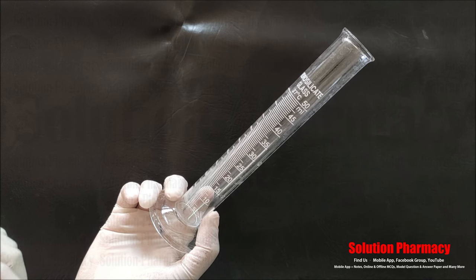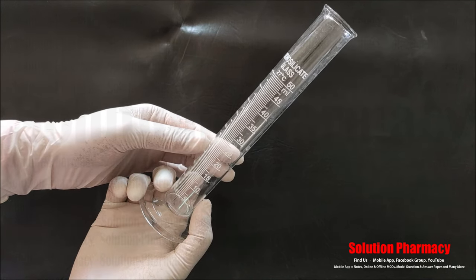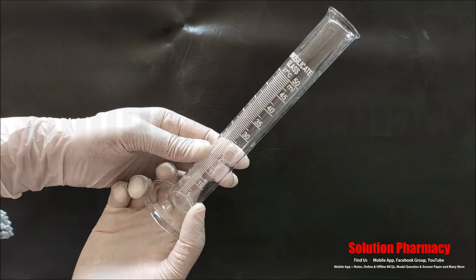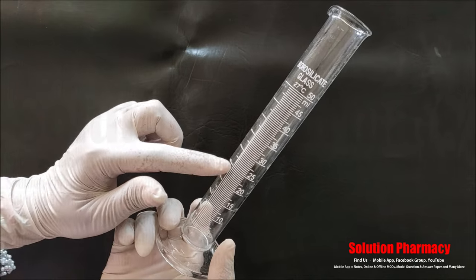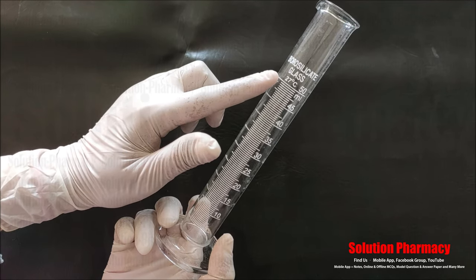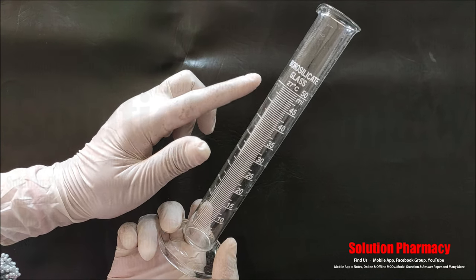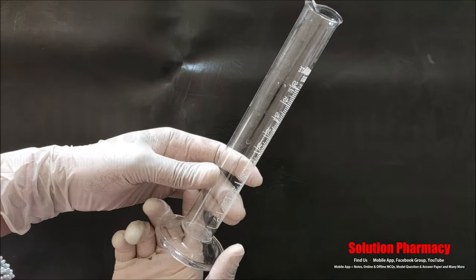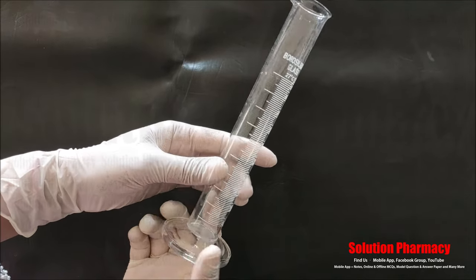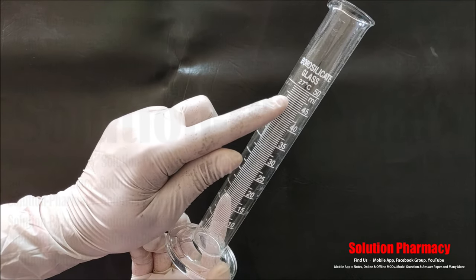Next you can see this glassware — it is called a measuring cylinder. It is a tall, narrow container which we use to measure the volume of liquid. This is a 50 ml measuring cylinder with divisions of 5 ml. Every division is 0.5 ml, so 1 division equals 0.5 ml. Since it has markings of different volumes it is graduated, and is also called a graduated cylinder.